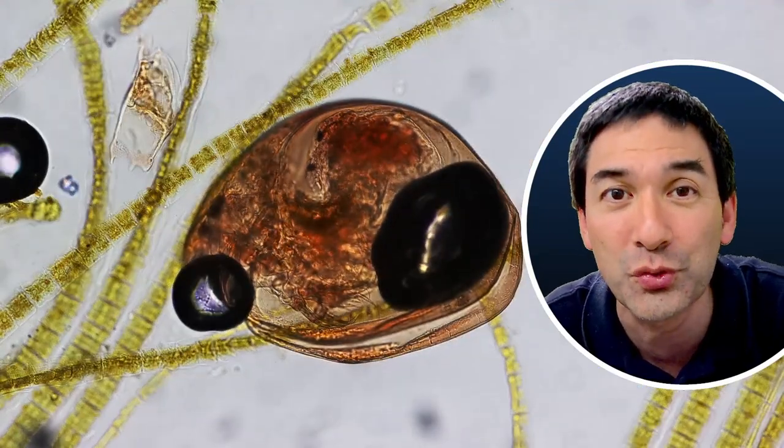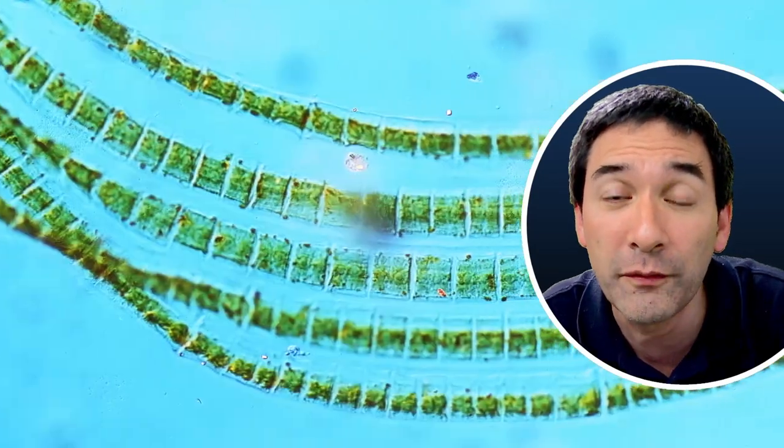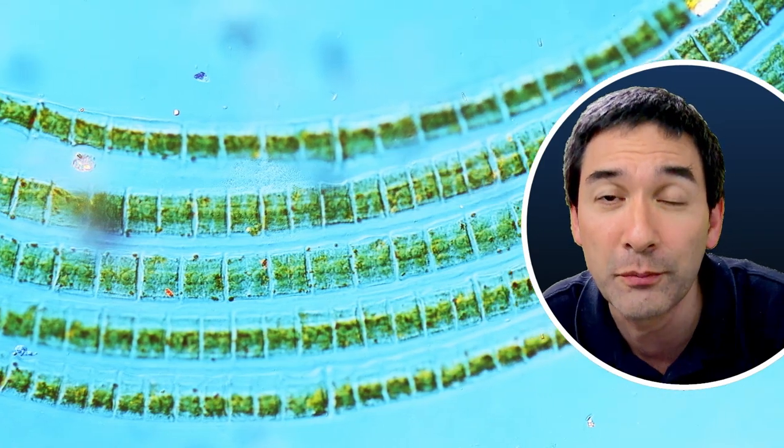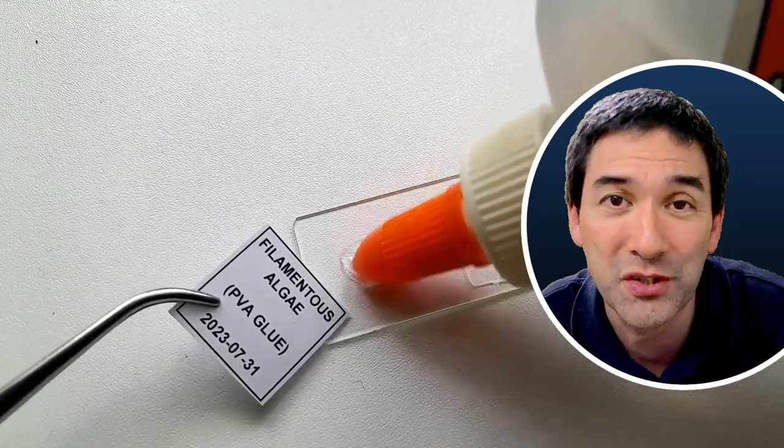Here for example is a little water crustacean that was also preserved. Many of the solvent-containing mounting media dissolve the pigments of the algae and the chlorophyll starts to leach out, and this is of course a problem.